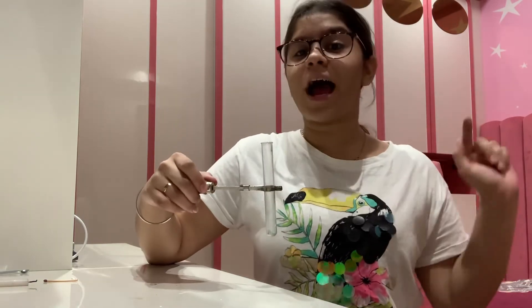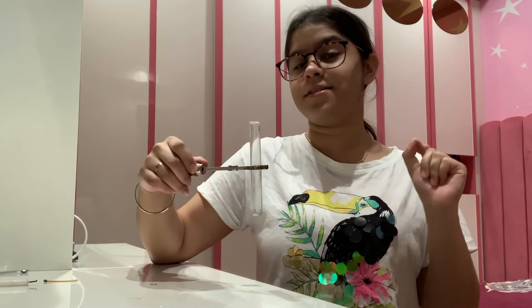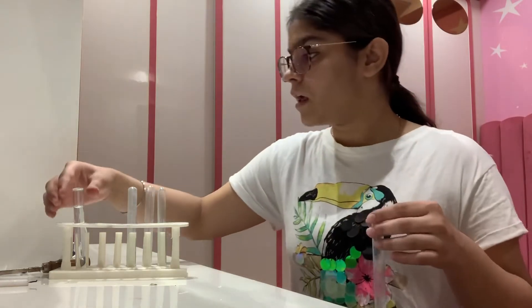Now when we add water to it, it will turn into the blue crystals that we had at the beginning of the experiment. This is the anhydrous copper sulfate.